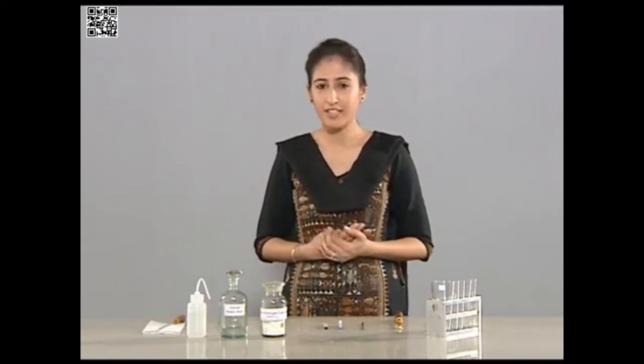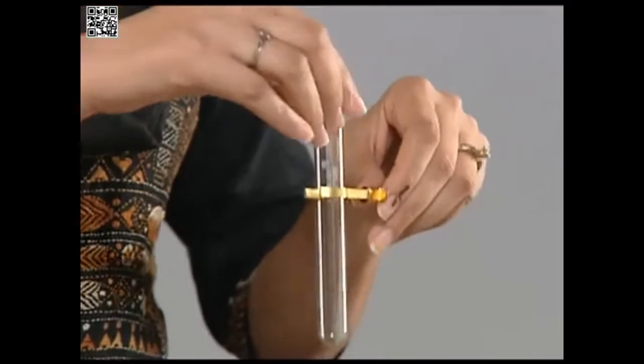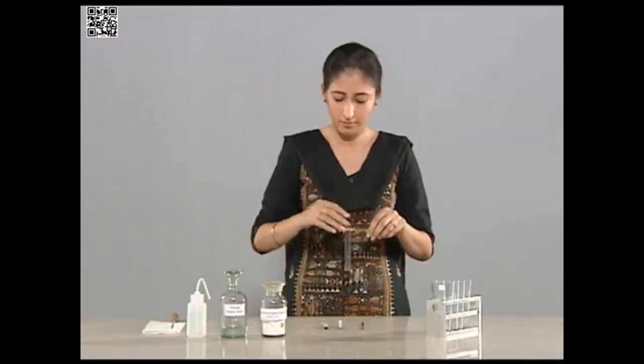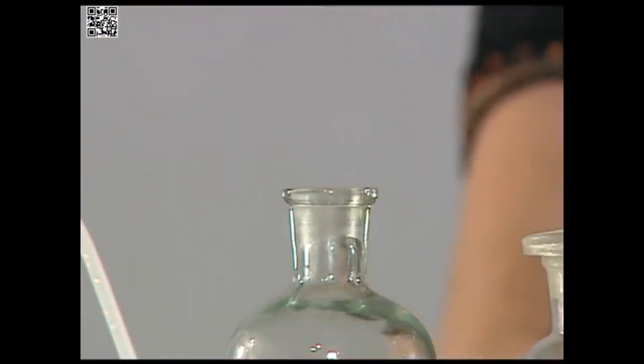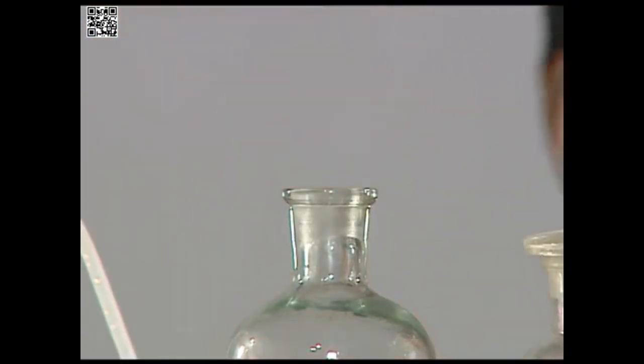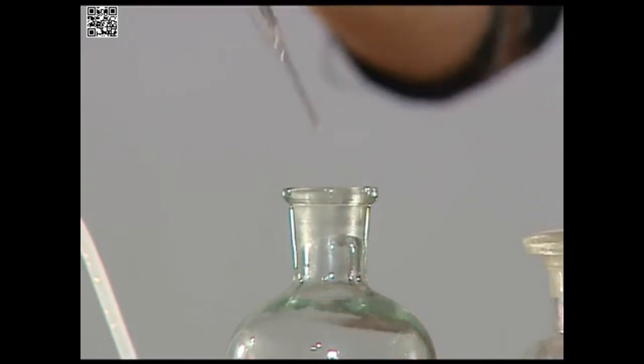While conducting this experiment, handle acetic acid carefully as it is a pure form of acid and is corrosive. Take a test tube and add a few drops of glacial acetic acid to it.